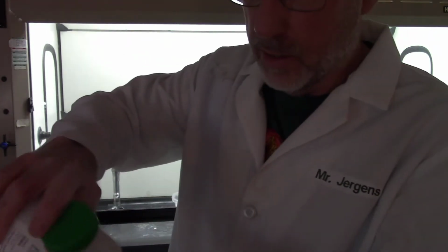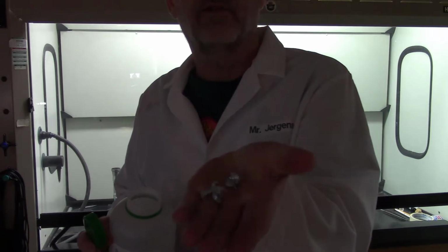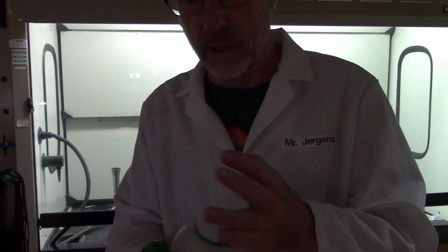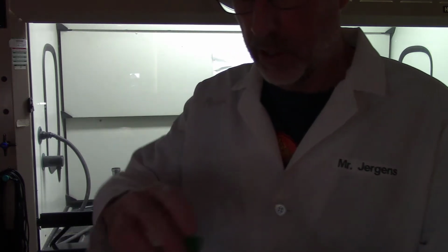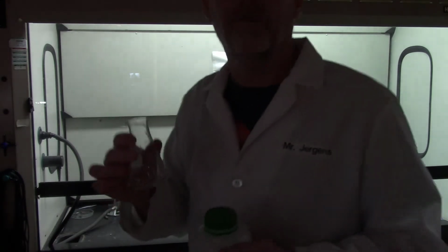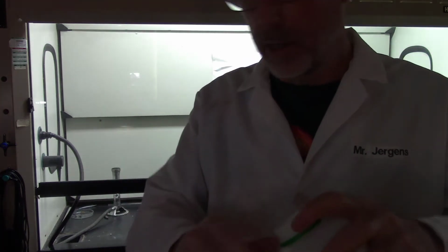back here in the middle part, you'll see the activity series, and you can start thinking about zinc. The zinc that I'm going to use is called mossy zinc, and it's kind of like the leftover stuff when they're using zinc, and the U.S. uses hundreds and hundreds of tons of this stuff for lots of different things every year. We'll be taking some zinc and we'll put it into an Erlenmeyer flask. Just put a little random amount right now.